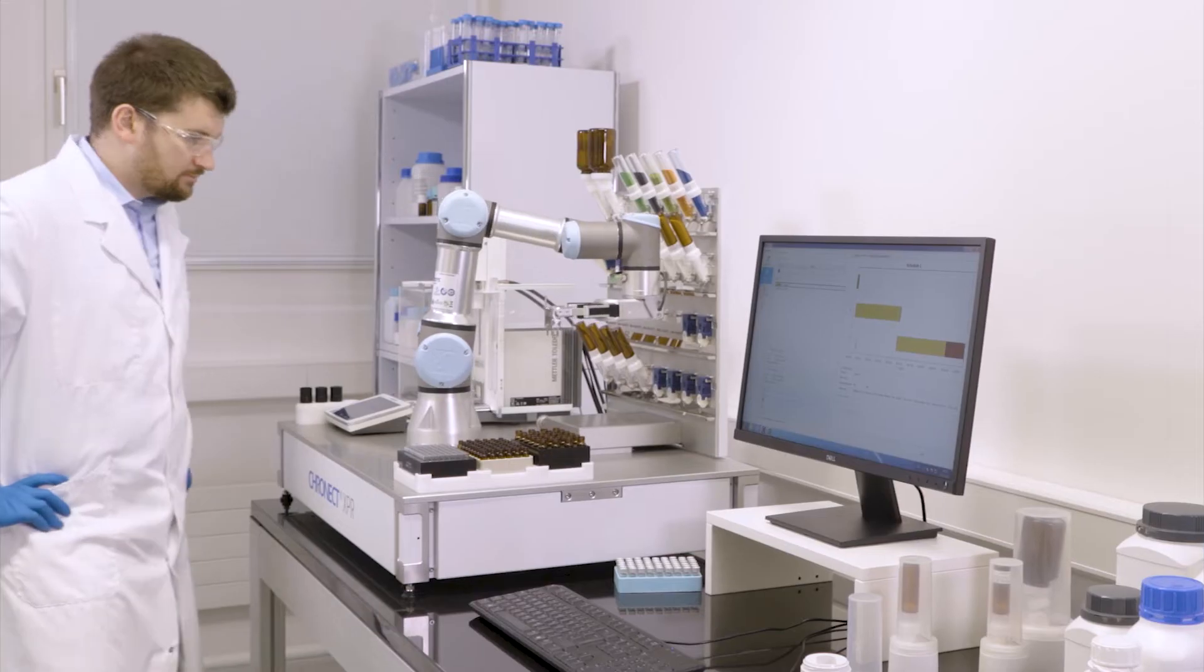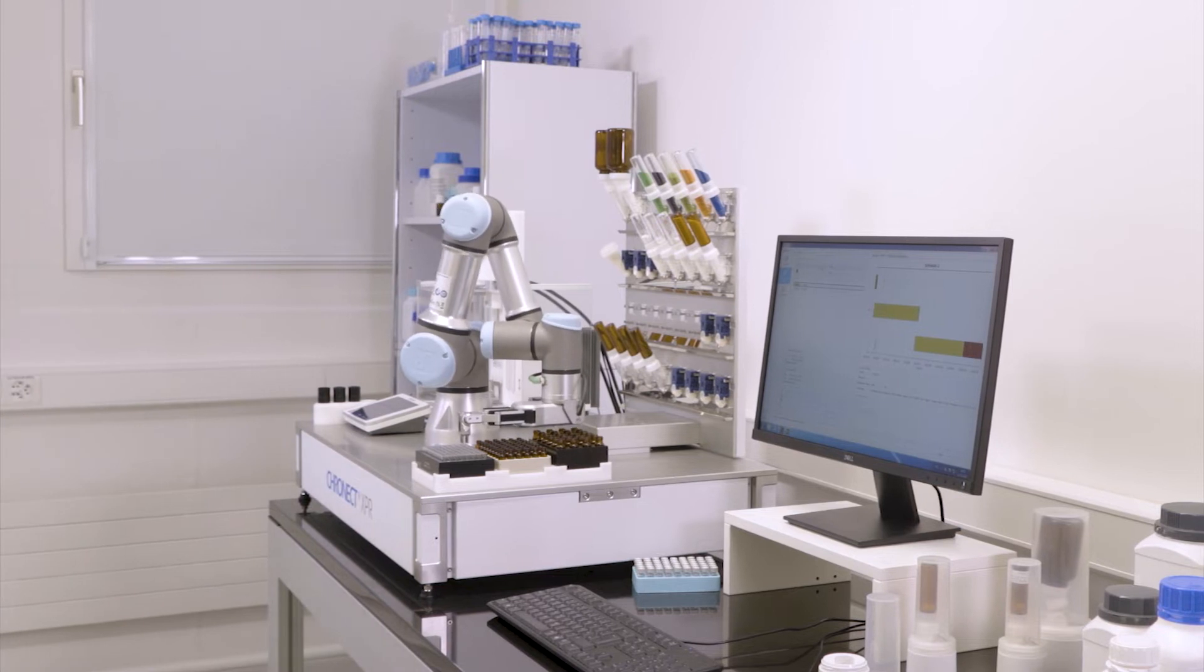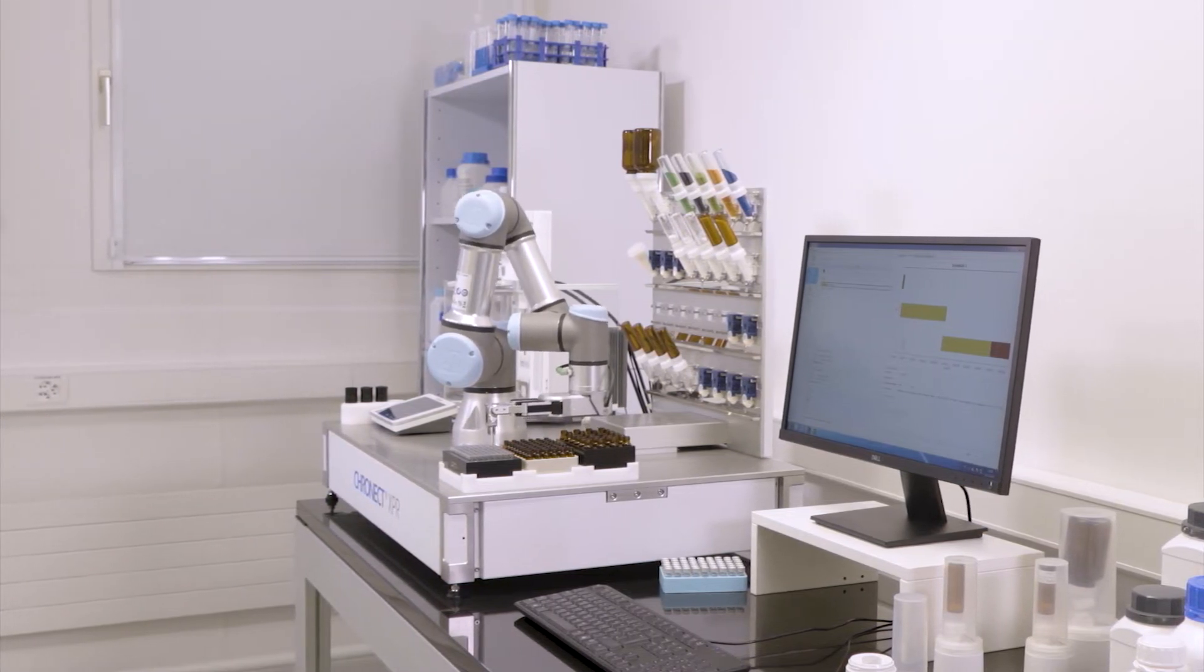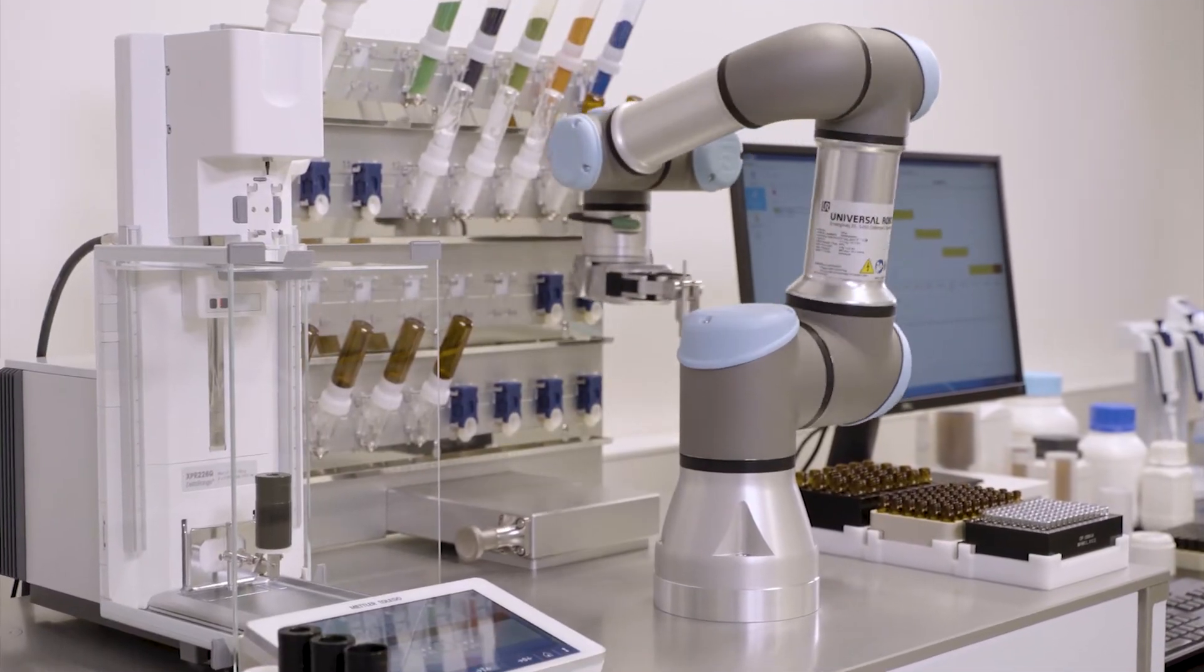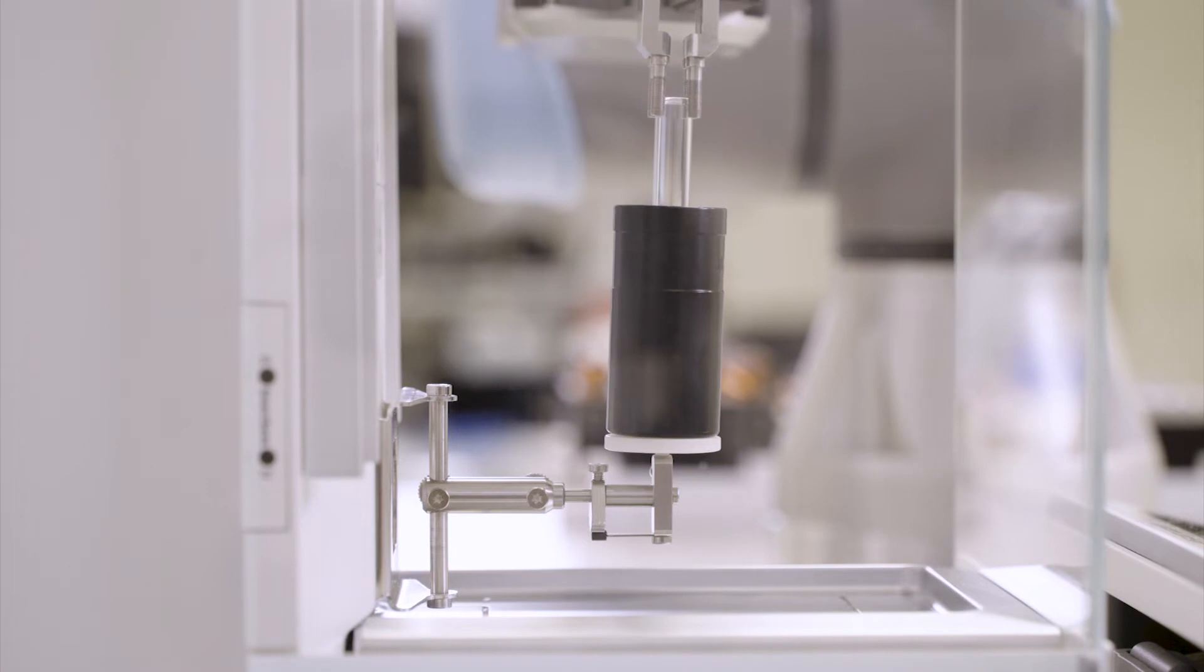Once the process starts, the user can step away from the lab and let the robot do the tedious work. The robot gently places the vial into the vial adapter on the balance.